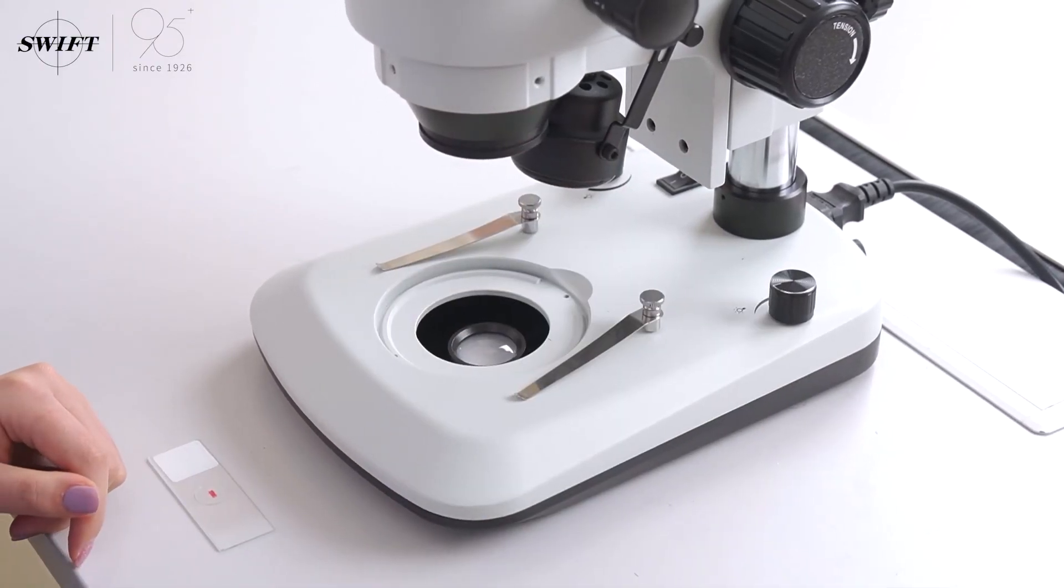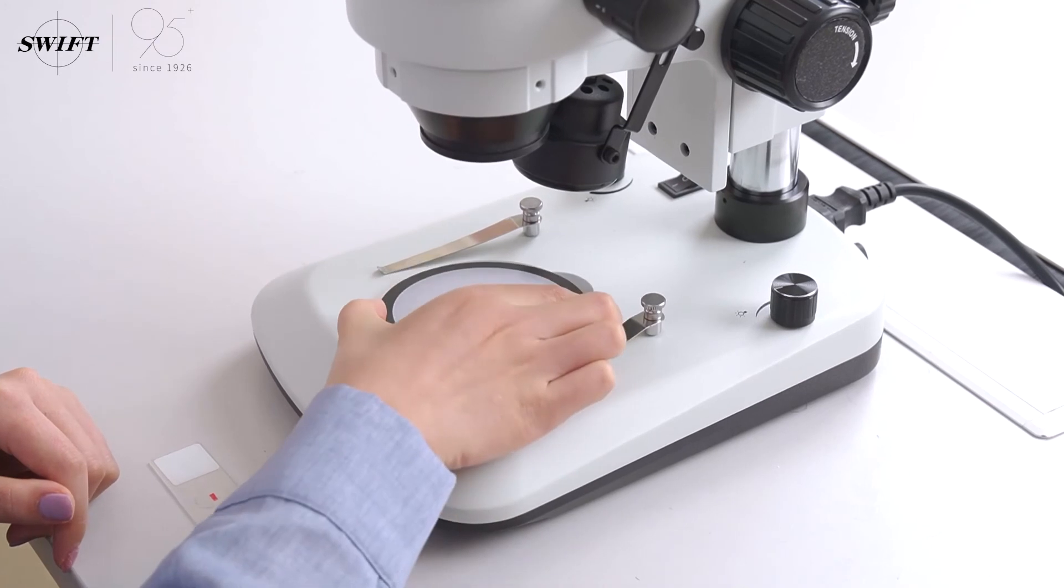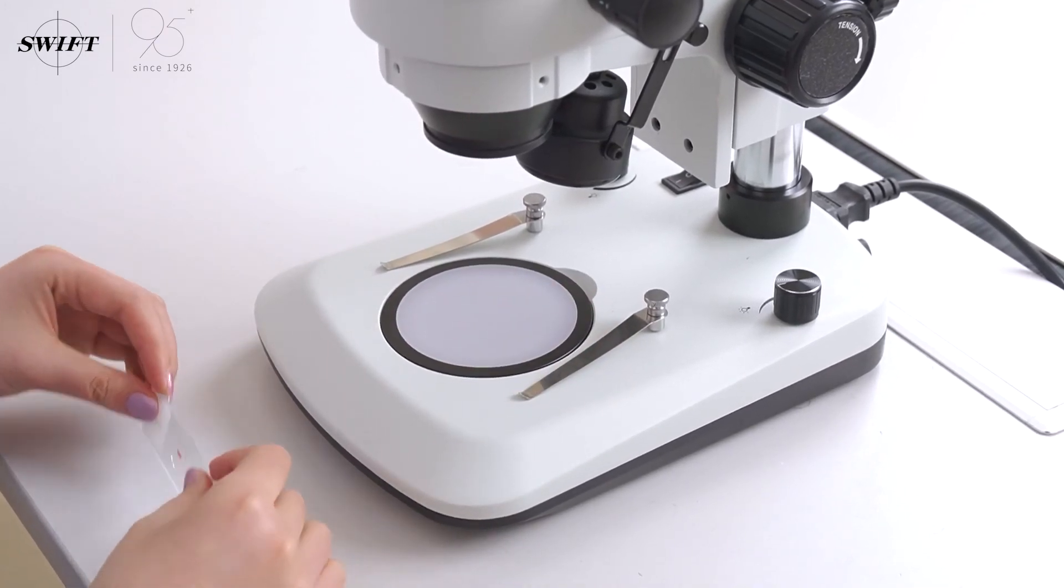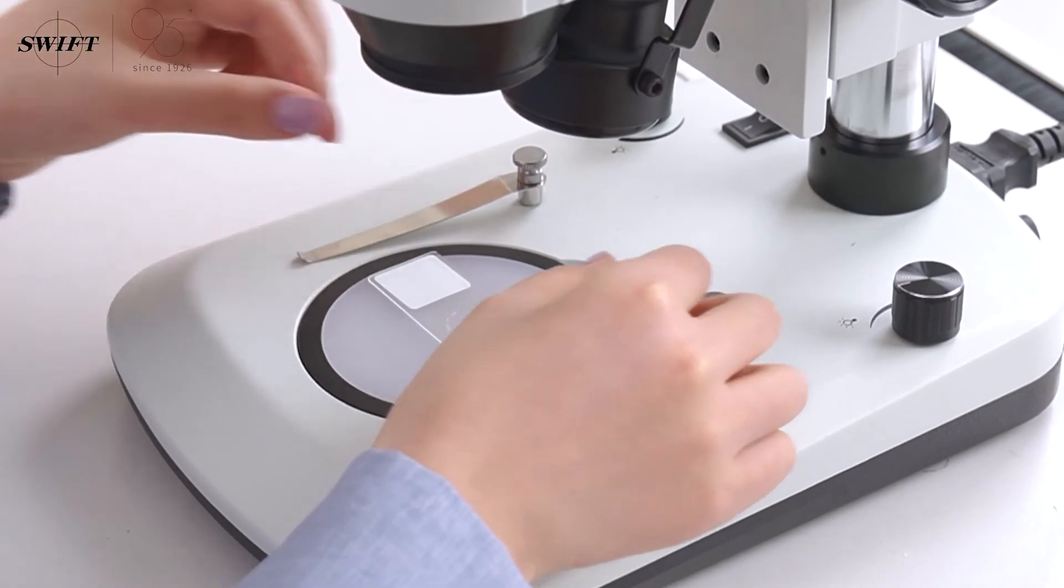Replace the work table to observe plant slices or larger animal tissue slices. A variety of samples can be replaced and observed to obtain unexpected results.